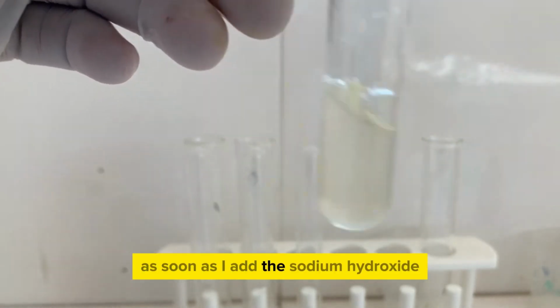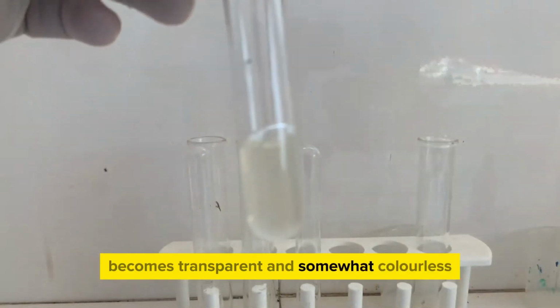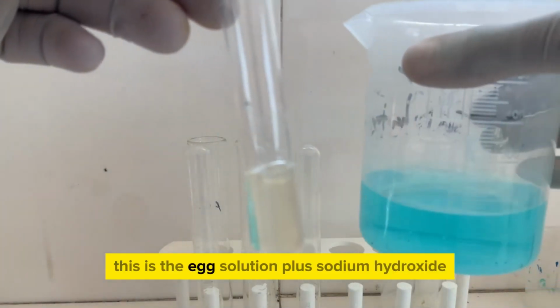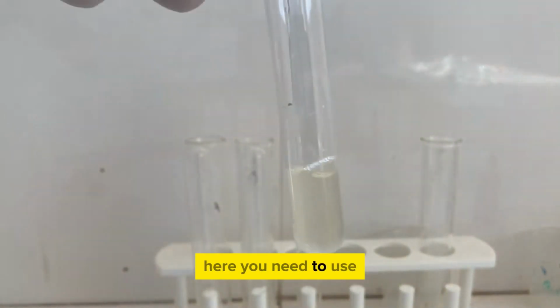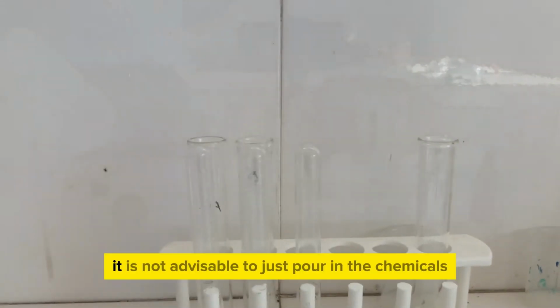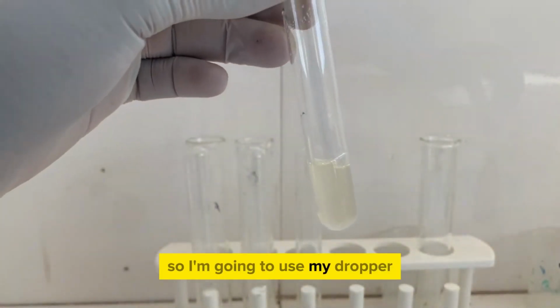As soon as I add the sodium hydroxide, it decolors the egg solution, which becomes transparent and somewhat colorless. You can see the difference here. This is the egg solution, this is the egg solution plus sodium hydroxide. So it has changed. Again, here you need to use a dropper to add a few drops of copper sulfate. It is not advisable to just pour in the chemicals because you miss the end point. So I'm going to use my dropper.